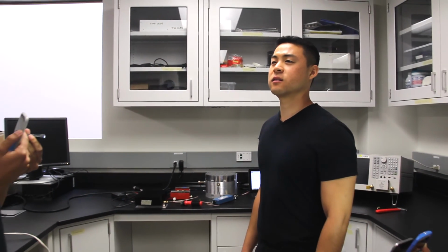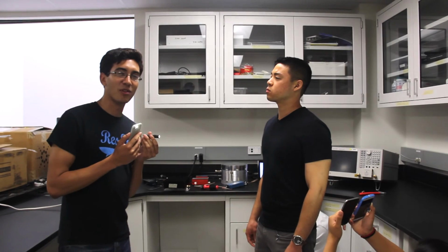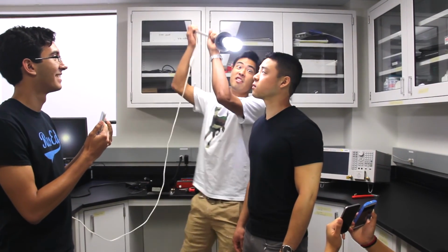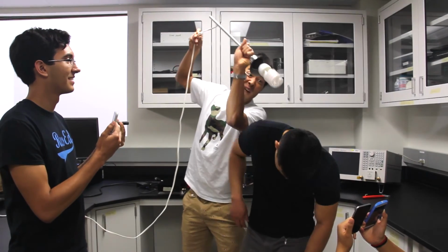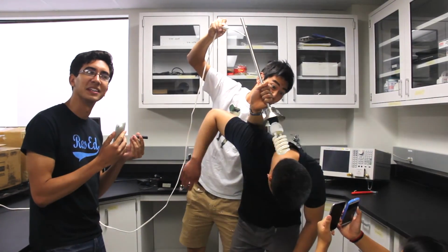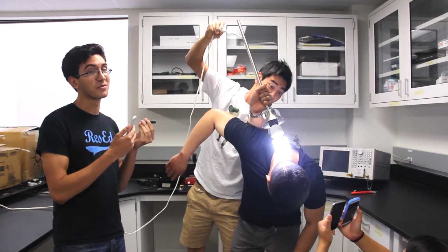So here we've set the signal generator to 1500 gigahertz. Wait, no, that's too high. That's like 10G. I've got a bright idea. Yuji, stimulate him again. Okay. Wait, did we need the blue LED or the yellow LED? Either way, proof the system works.